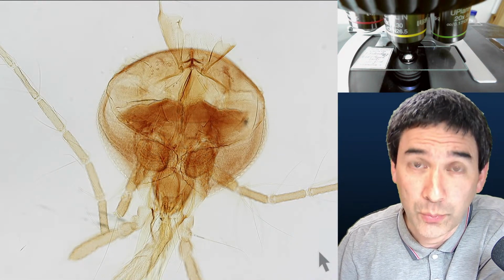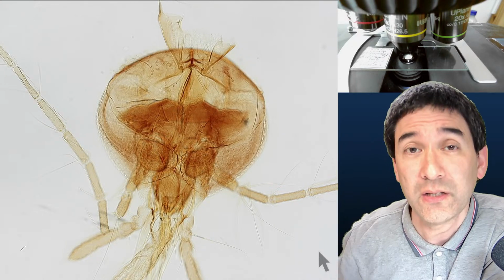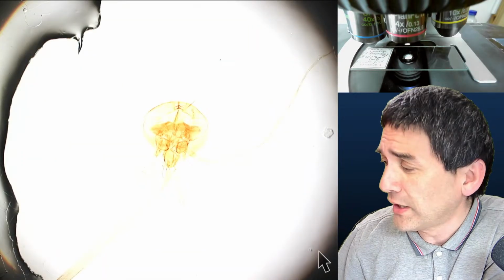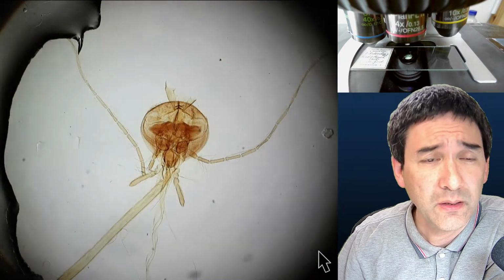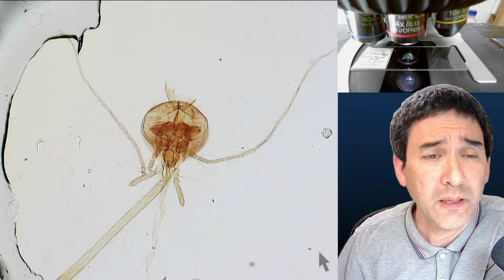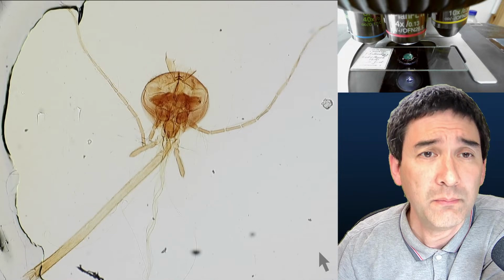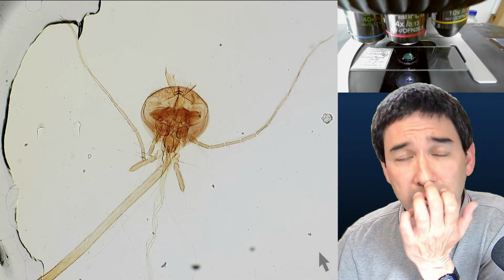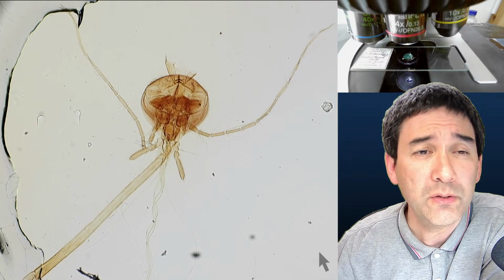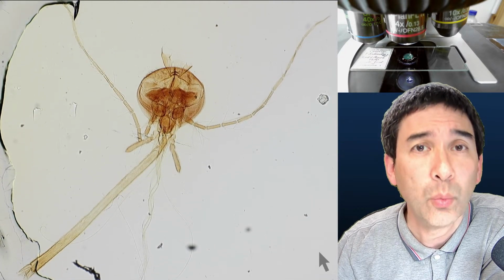That certainly would be a possibility, but at the same time I'm also losing some details, so I cannot zoom in so much. Here with a 4x objective I'm still able to capture more. But even at the lowest magnification, sometimes the specimen is even larger than what I'm able to see. So how can you combine the different parts together into one final image?